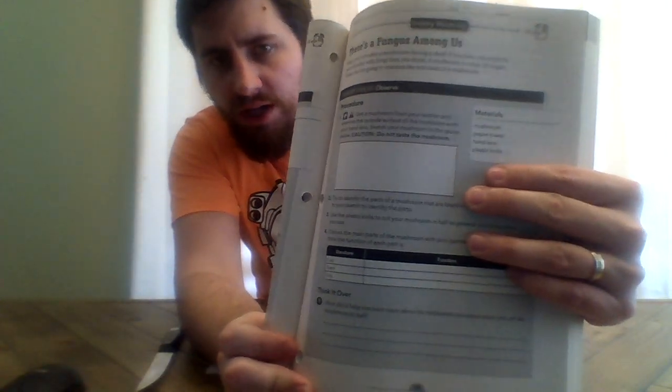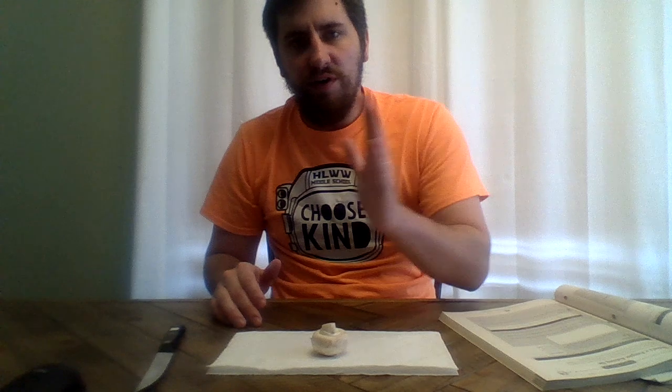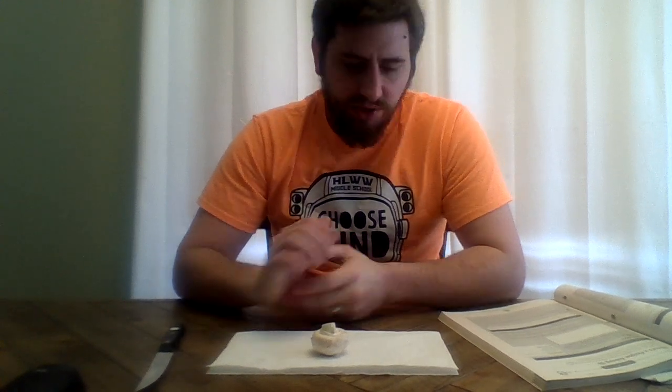Okay, so I'm going to try to identify some parts of the mushroom that are listed on the table. You don't have this in front of you, but I can put it up here. The three structures that I want you to identify are the cap, stem, and gills. If you read the textbook, on page 67 there's a picture of a mushroom with those structures on it, when you're reading about fungus from pages 66 to 69 on Wednesday. So let's talk about those.